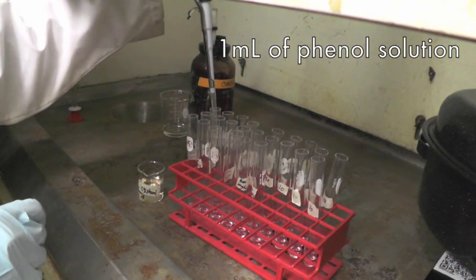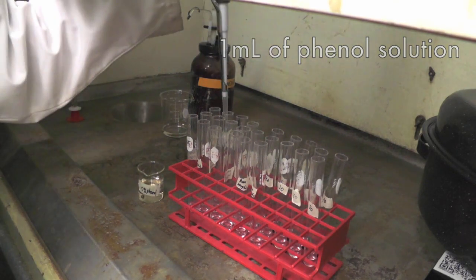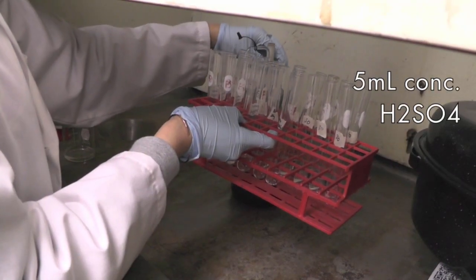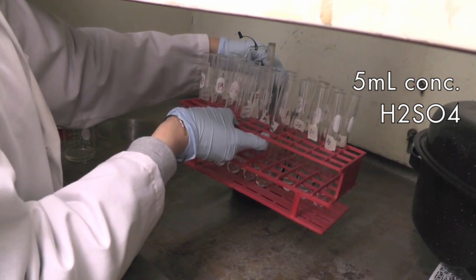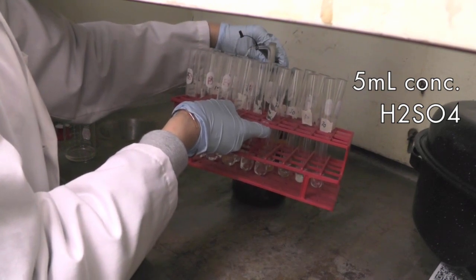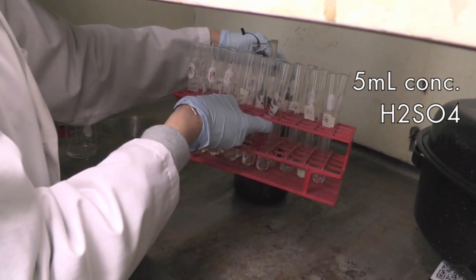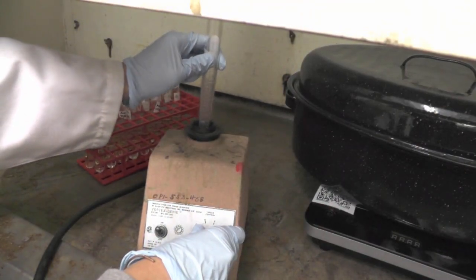In the fume hood, add 1 ml of phenol using the pipette and 5 ml of concentrated sulfuric acid with the auto dispenser into each test tube. Make sure the solution is dispensed directly into the liquid, not along the side of the test tube. Vortex each test tube briefly.